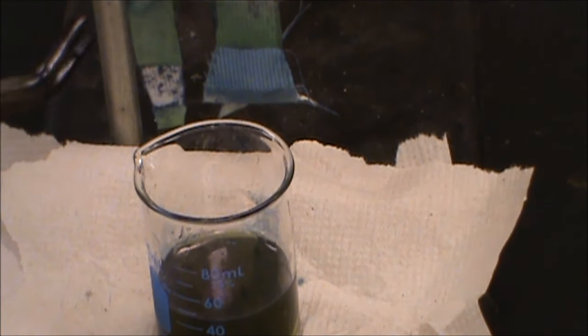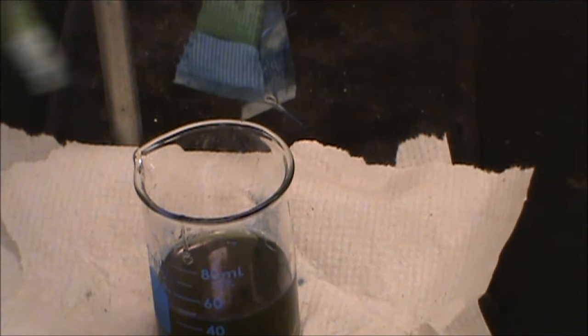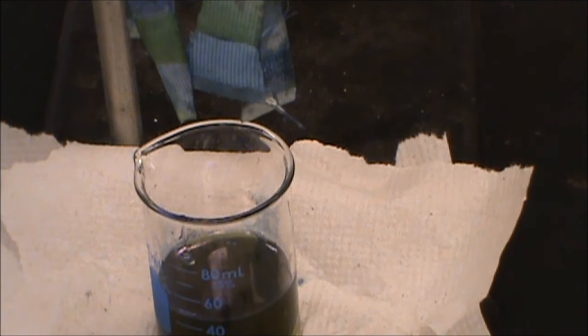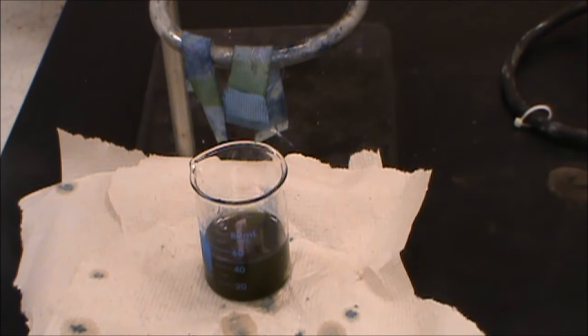You can see that color difference, especially right in here. That's the same, I think, as this strip here. But then as time goes on, both of these start to be turned blue from that indigo dye re-oxidizing from the air. And there we go, we have synthesized indigo dye and used it to stain different fabrics.